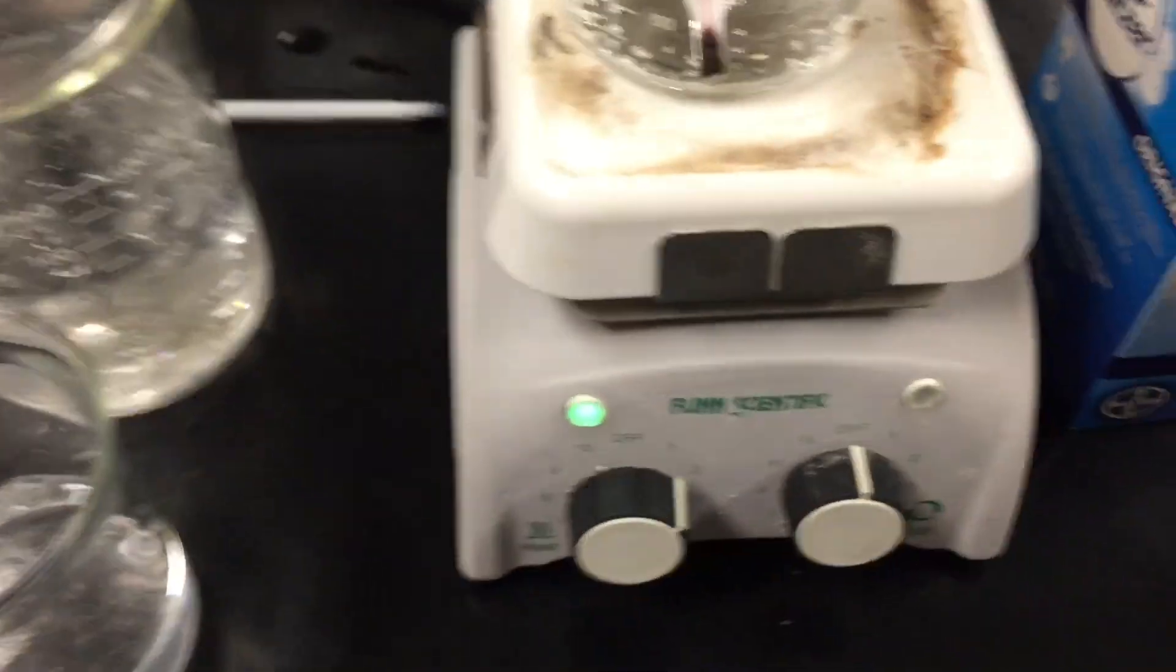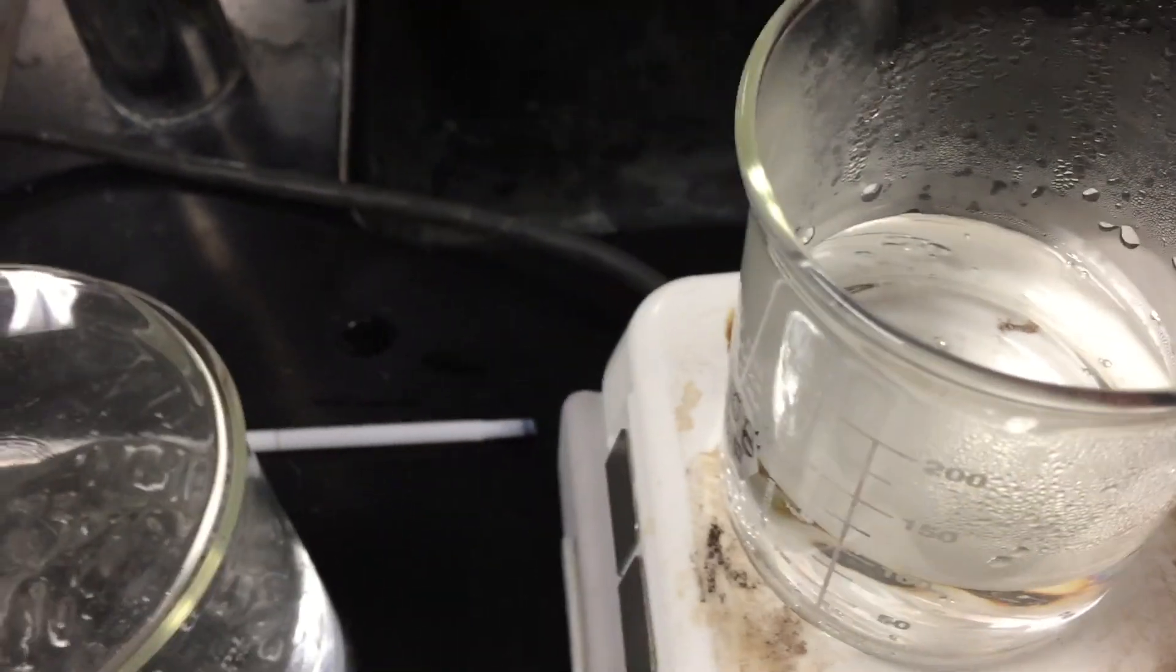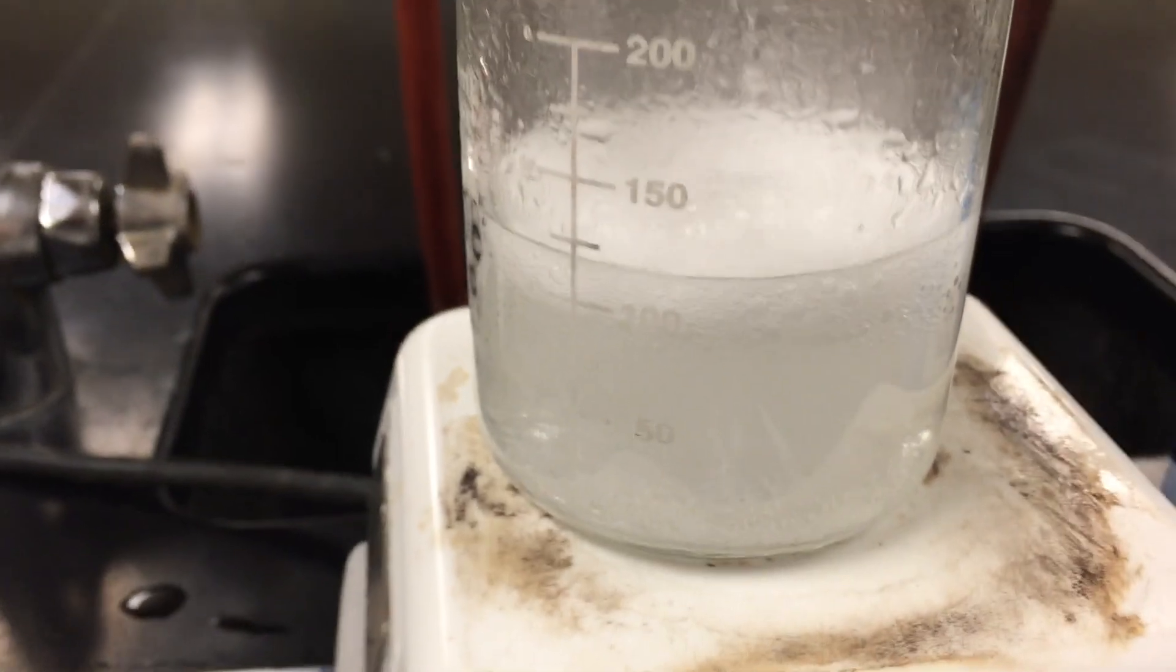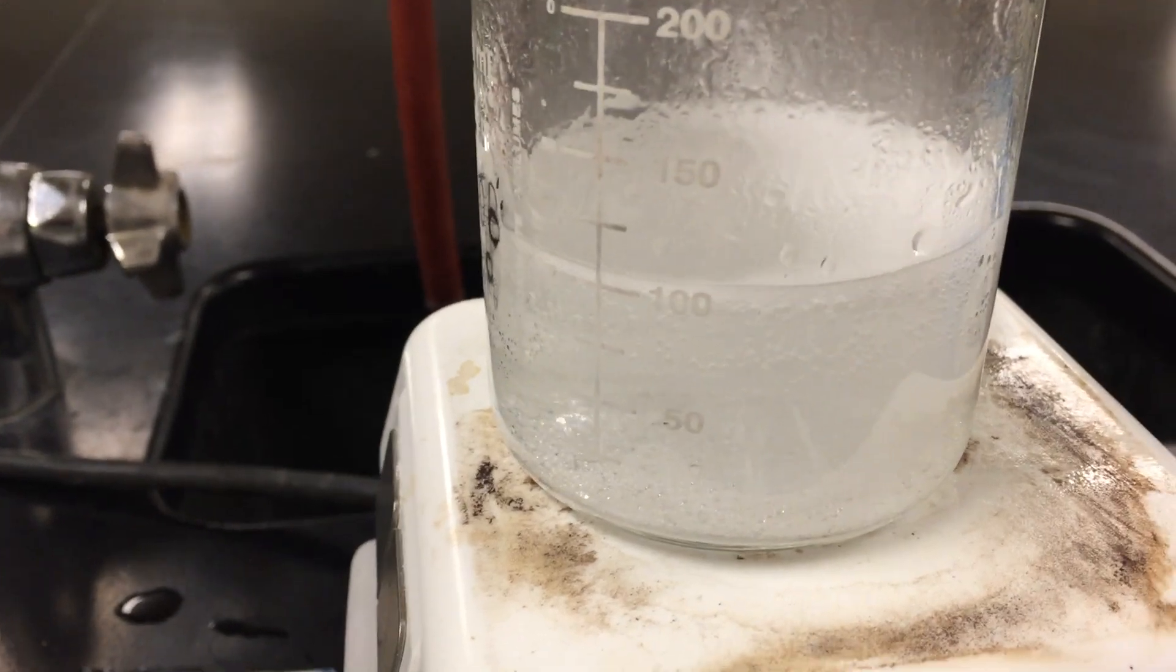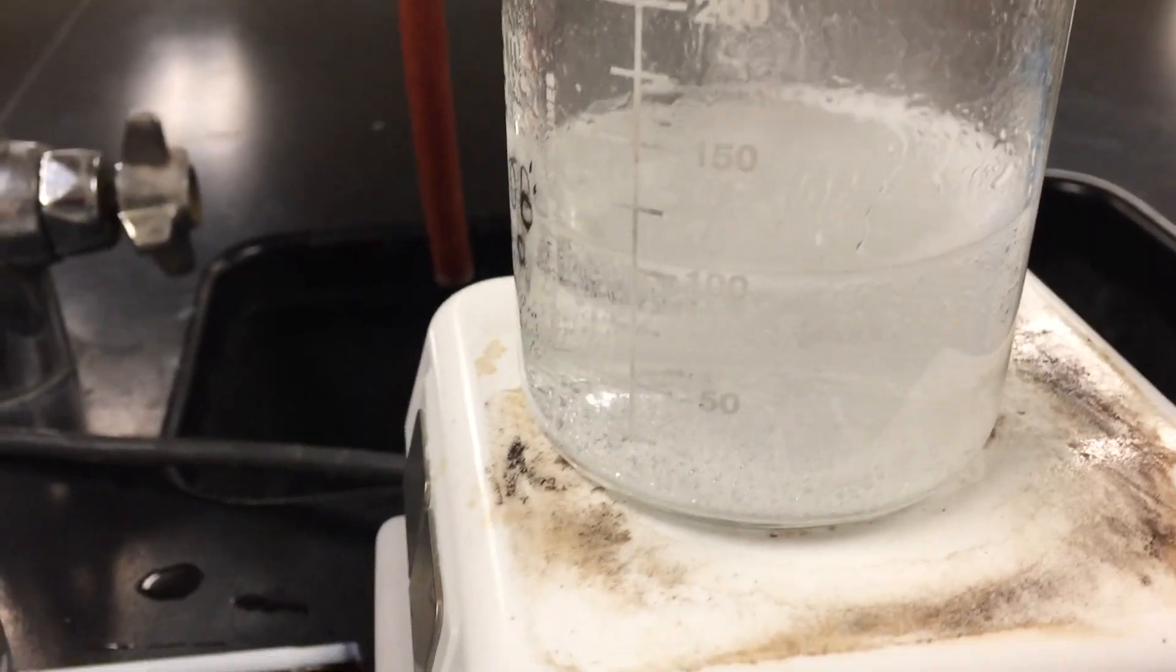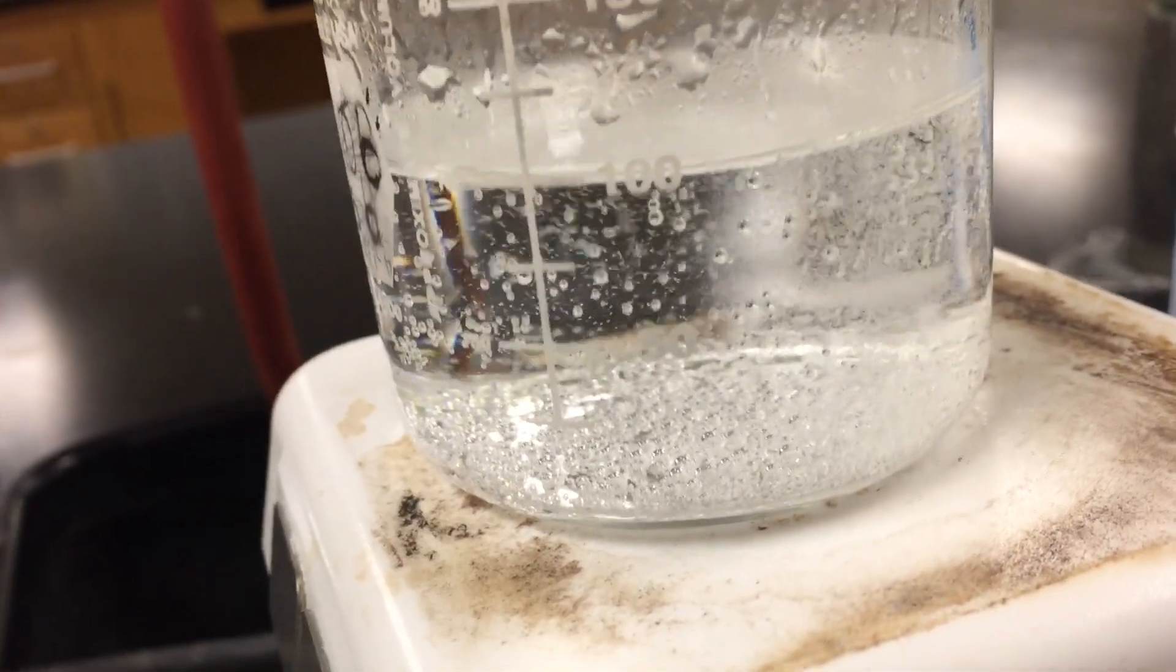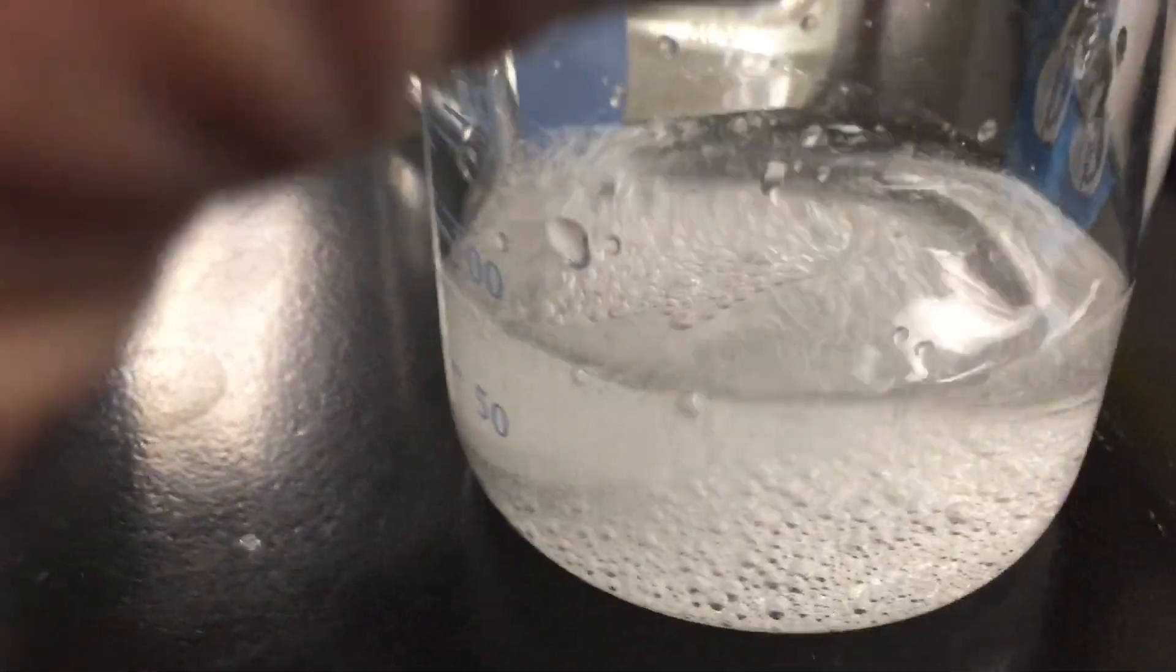What do you think is going to happen when I add an Alka-Seltzer tablet to my warm water? Let's take a look. Same size tablet in my warm water. And you can see that the tablet reacts considerably faster. So once again, the higher the temperature, the greater the kinetic energy of reacting particles, so the greater the chance for a meaningful collision. An increase in temperature will always speed up the rate of a reaction. So that Alka-Seltzer tablet has reacted, and this one here in the cold water is still slowly reacting, as you can see.